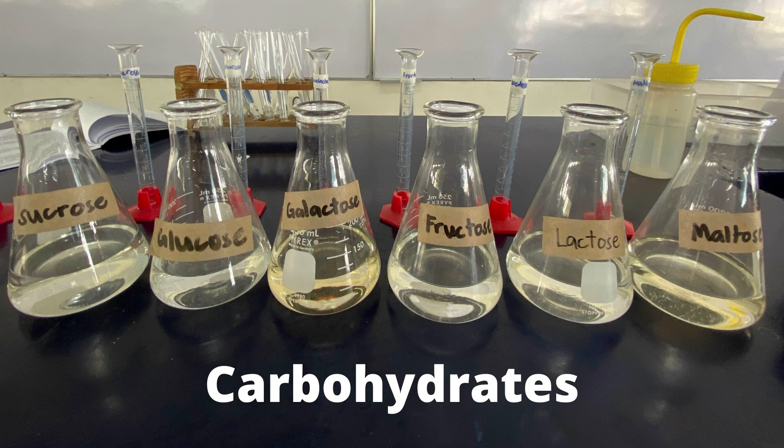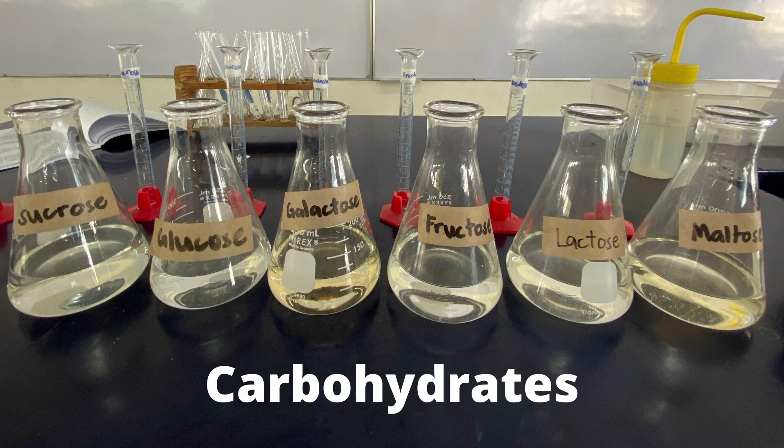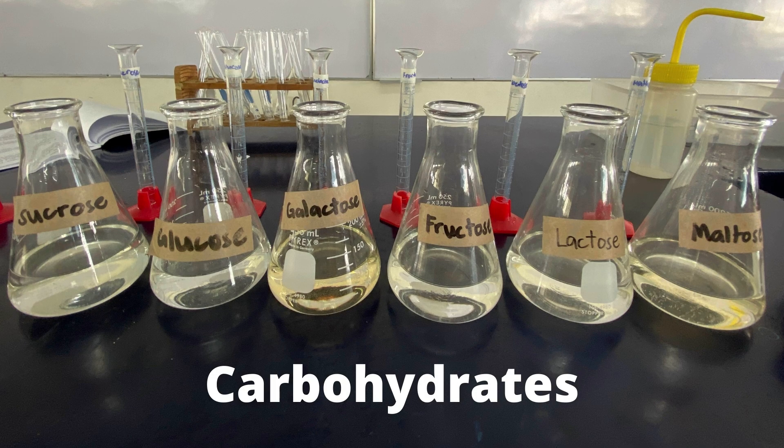And the carbohydrates used are: sucrose, glucose, galactose, fructose, lactose, and maltose.